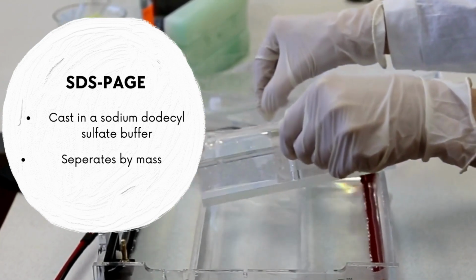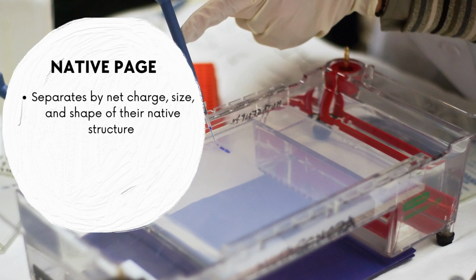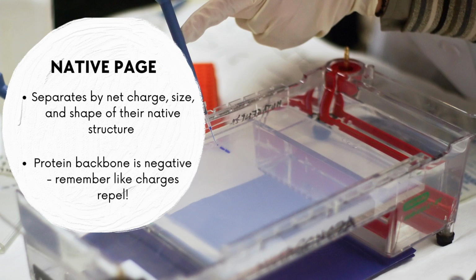In native PAGE, proteins are separated according to the net charge, size, and shape of their native structure. Electrophoretic migration occurs because most proteins carry a negative charge in alkaline running buffers. The higher the negative charge density, the faster a protein will migrate.